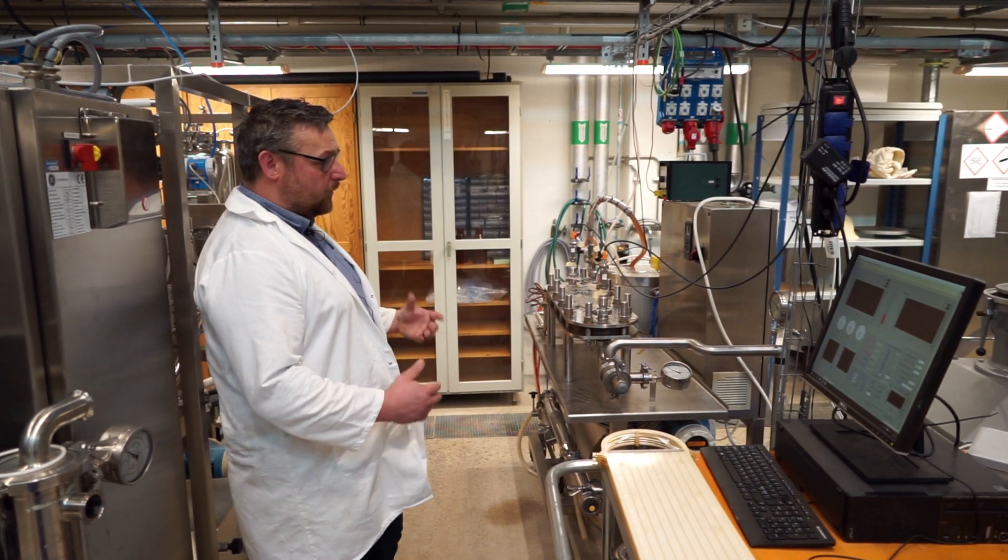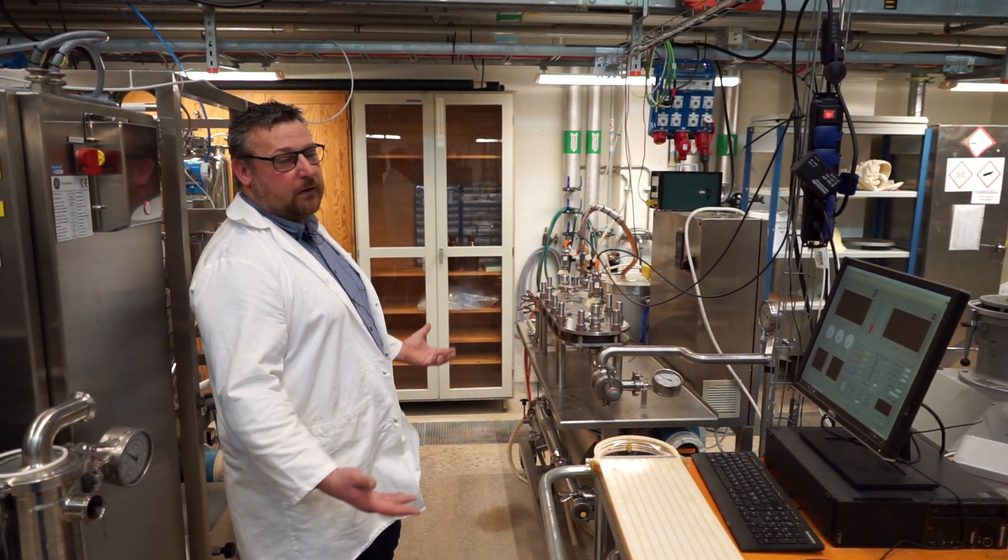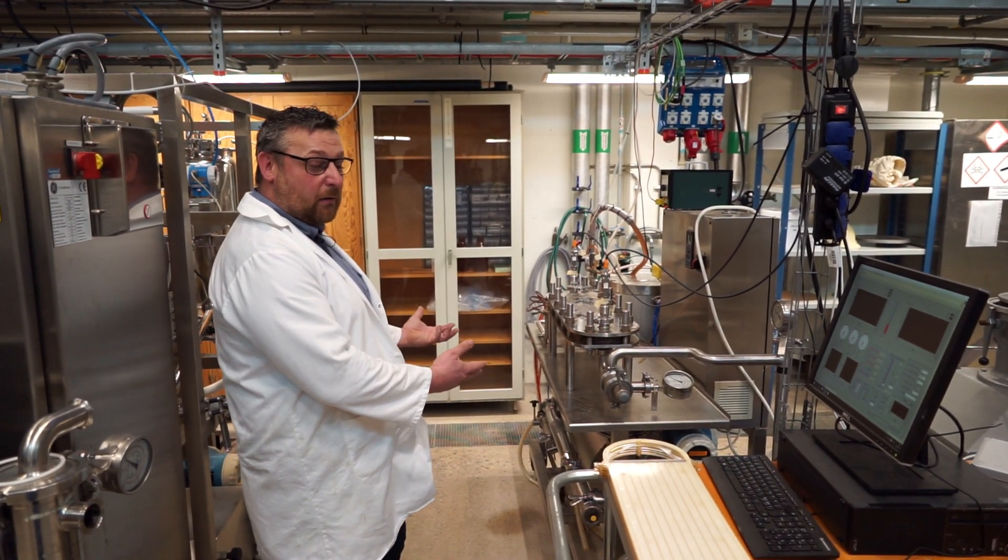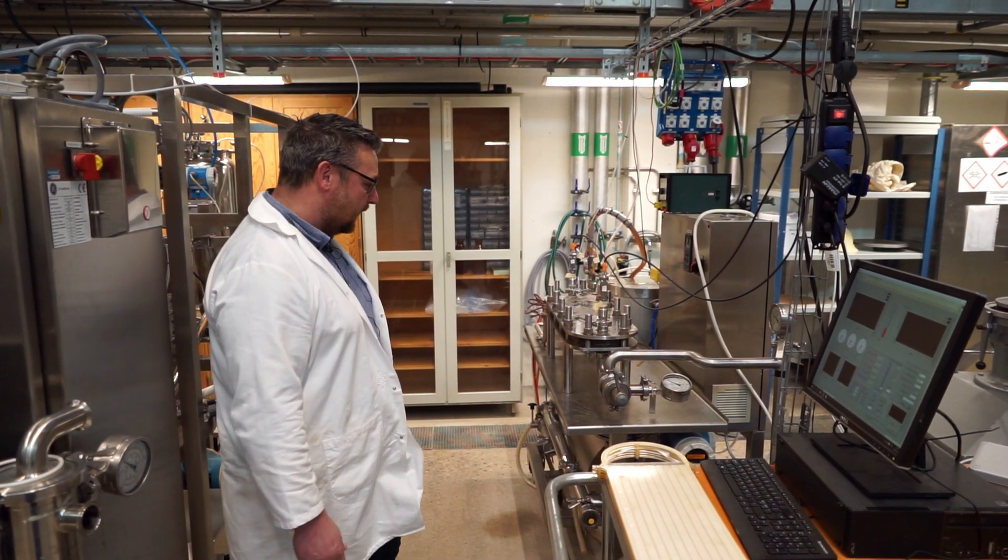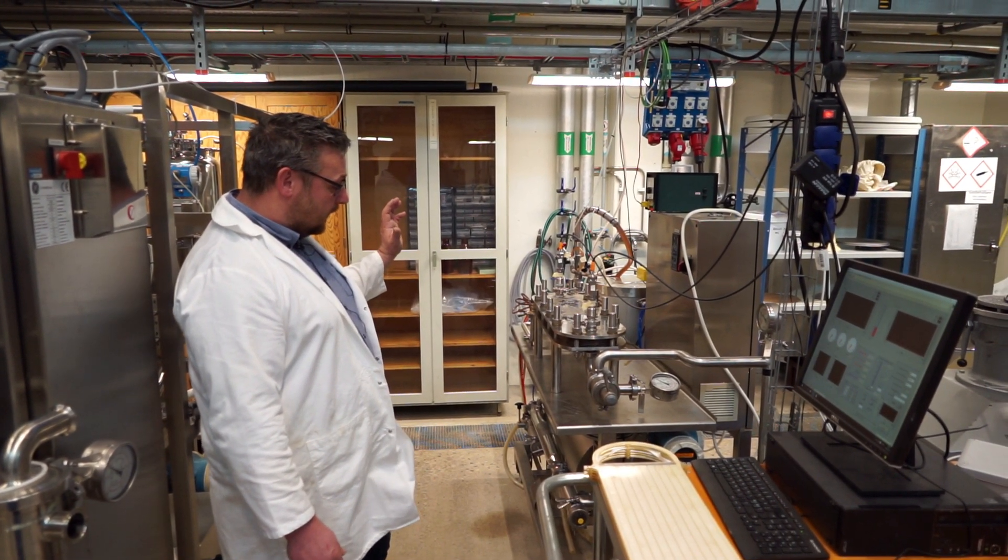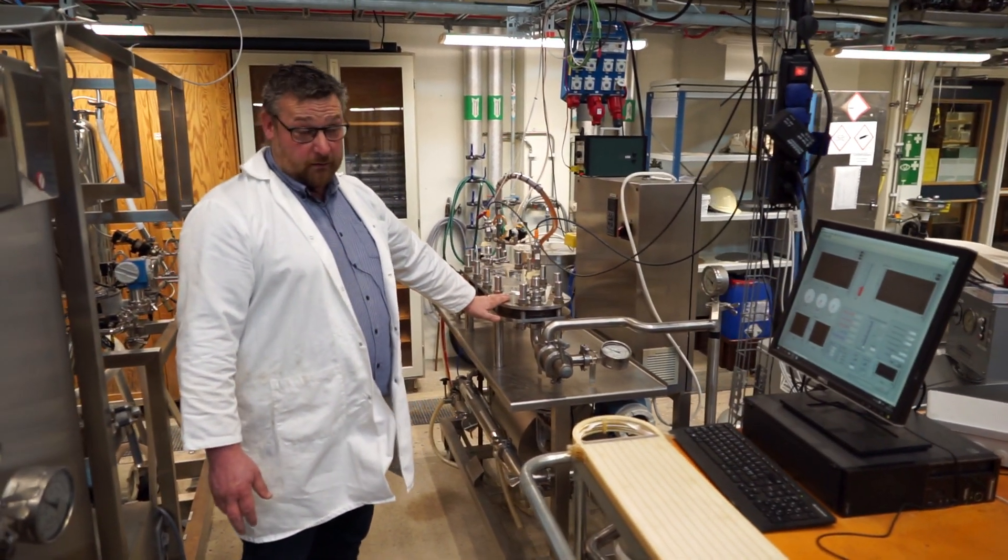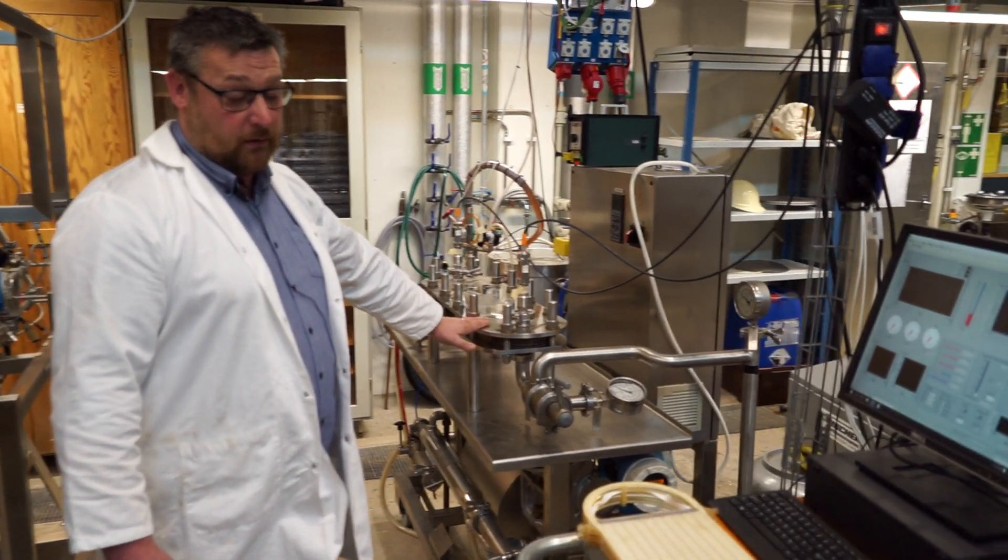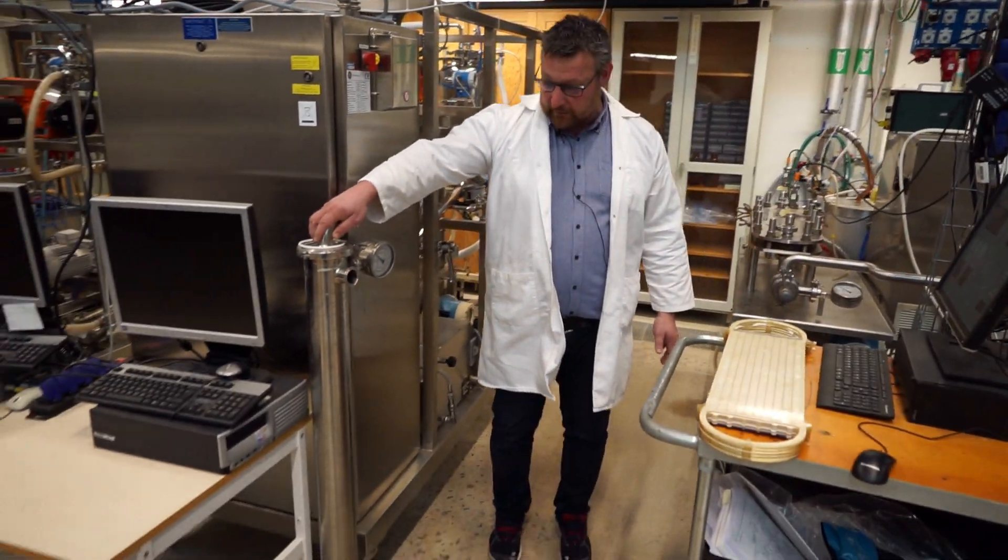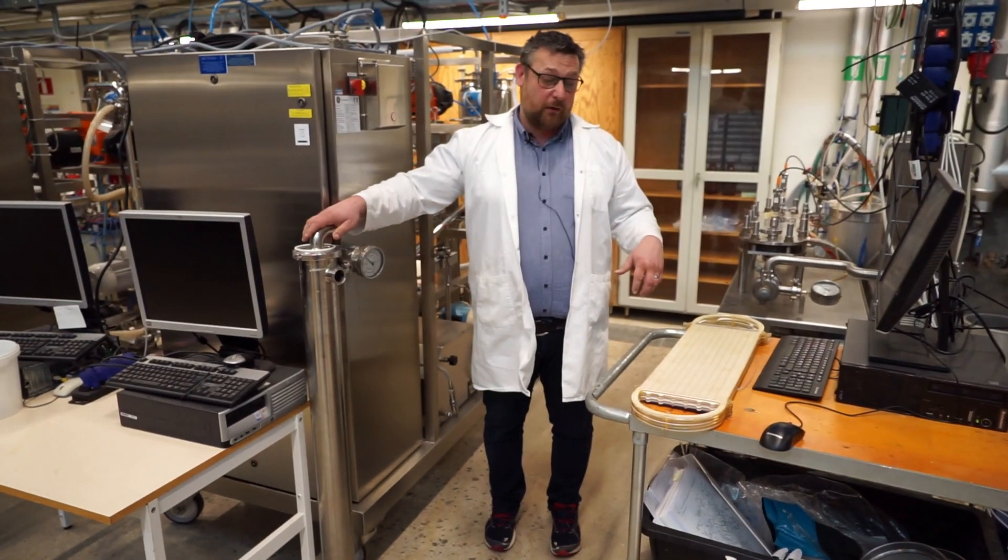When we have a hundred to a thousand liters of solution to treat, not working at lab scale, maybe at half a liter scale. This equipment has the possibility of either using a plate and frame module that is mounted here right now, or a spiral module that is standing right here. So it's interchangeable which type we are using.